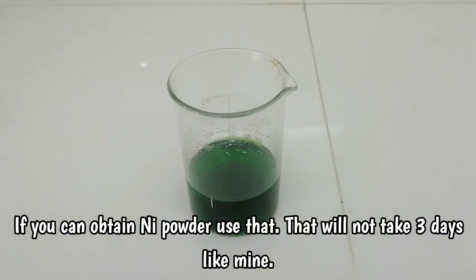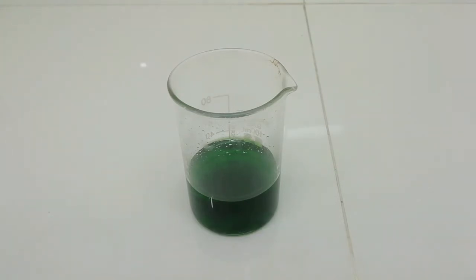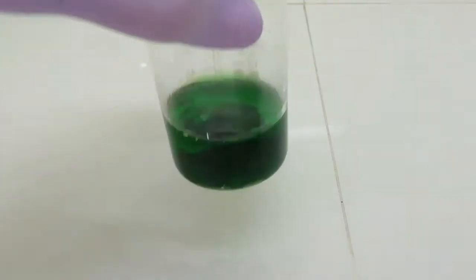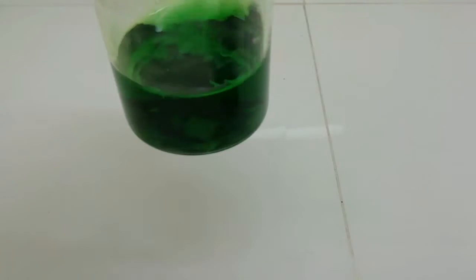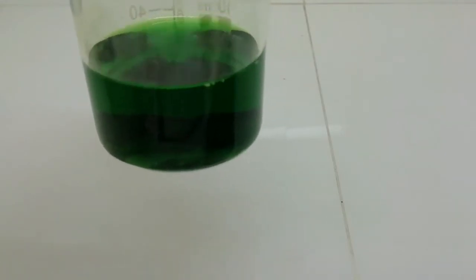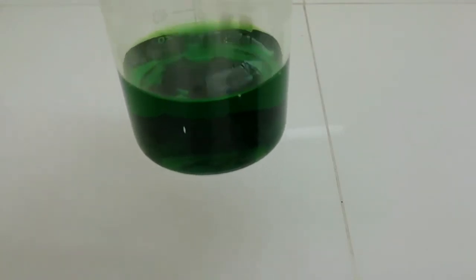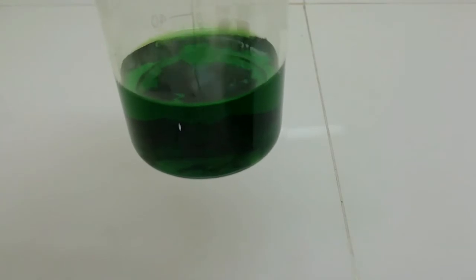And after three days you can see the solution like this. And still there is about a few grams of nickel metal left in the solution. So now I am not going to wait to react this nickel metal with the hydrochloric acid.